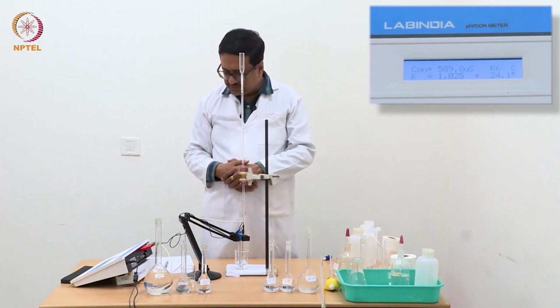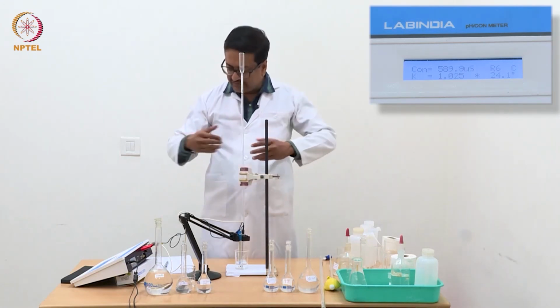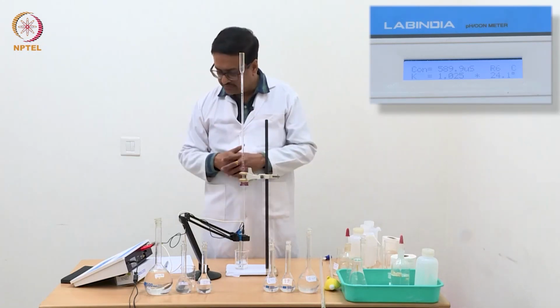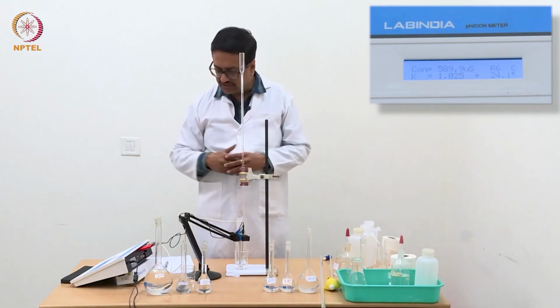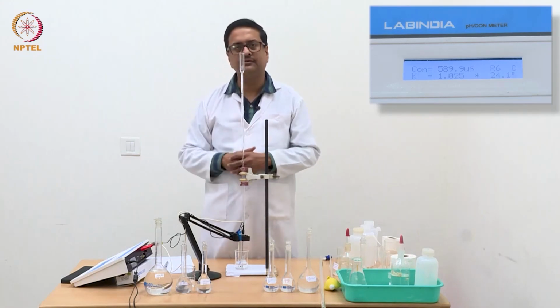If you see the difference between the initial readings, it was 782, then 740, difference is 40. 740 to 704 is again difference of about 40. Then it is 673, the difference is like 30. Then 629, so 630, that means about 40.